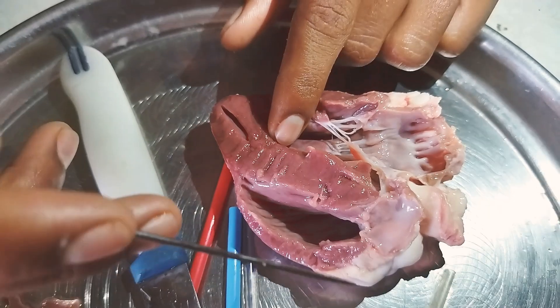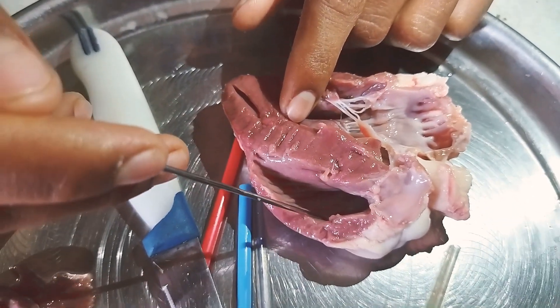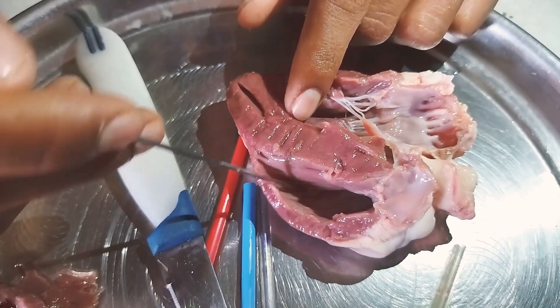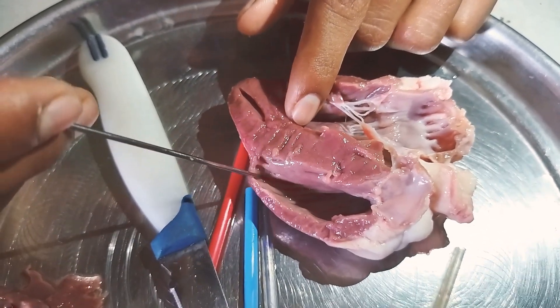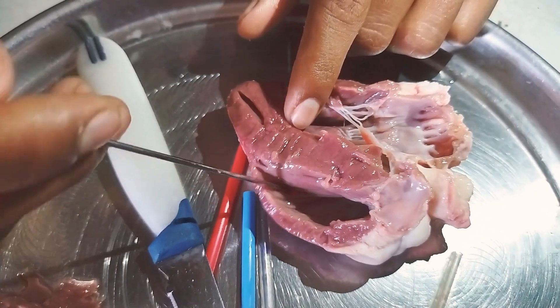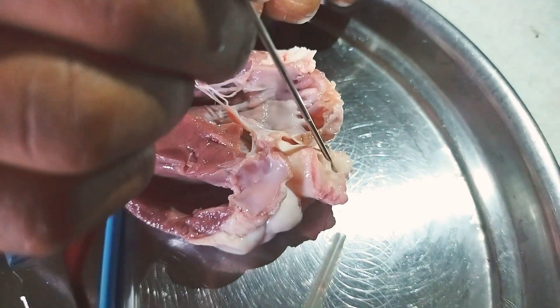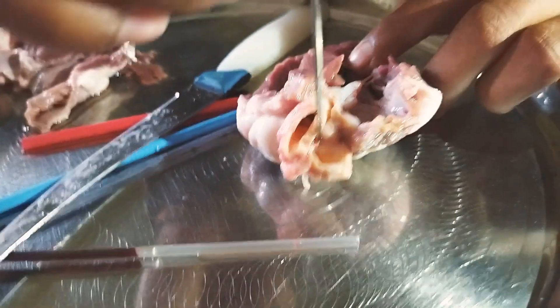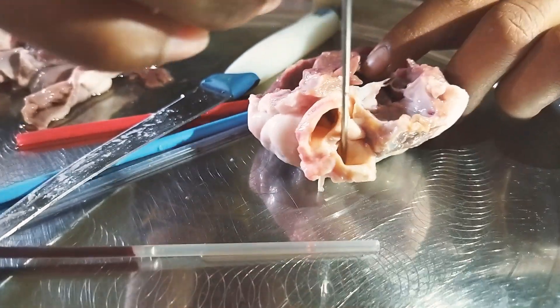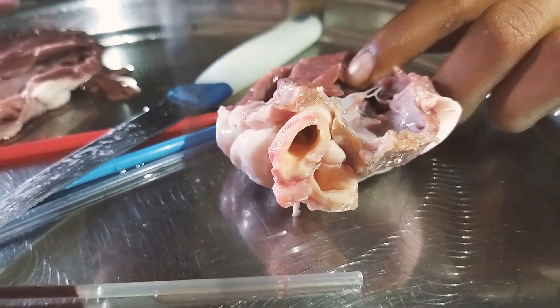From the pulmonary vein, the blood travels through the left atrium and the bicuspid valve, then into the left ventricle. From the left ventricle, this blood goes to the aorta. The aorta and its small arteries supply oxygenated blood throughout all our body parts.